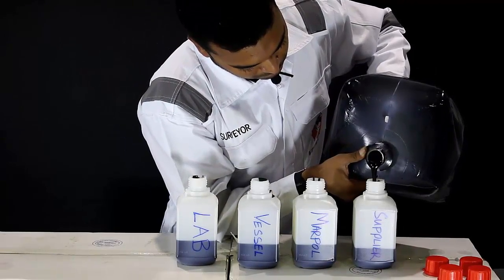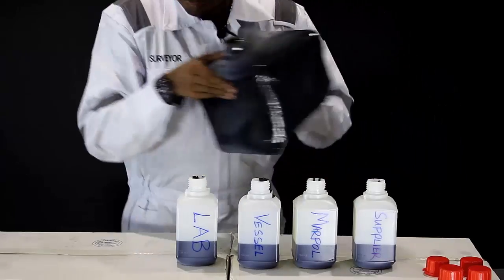At the end of this procedure, you should have 50% of the sample bottle containing fuel.